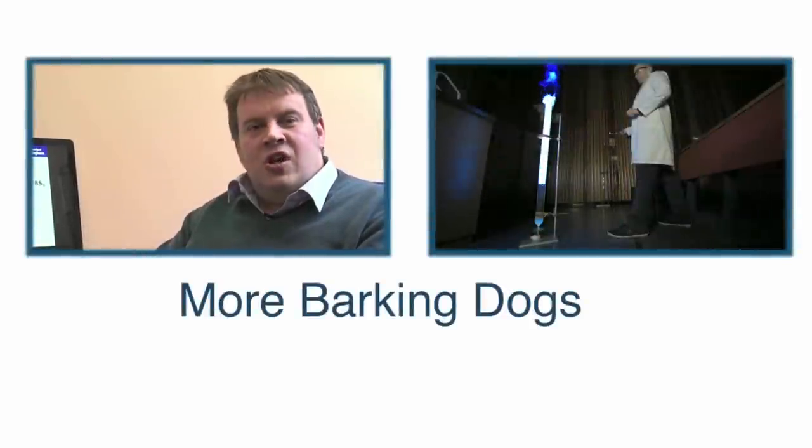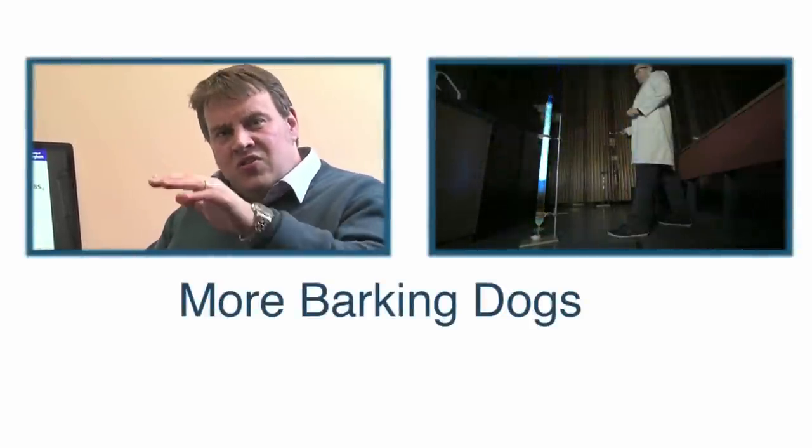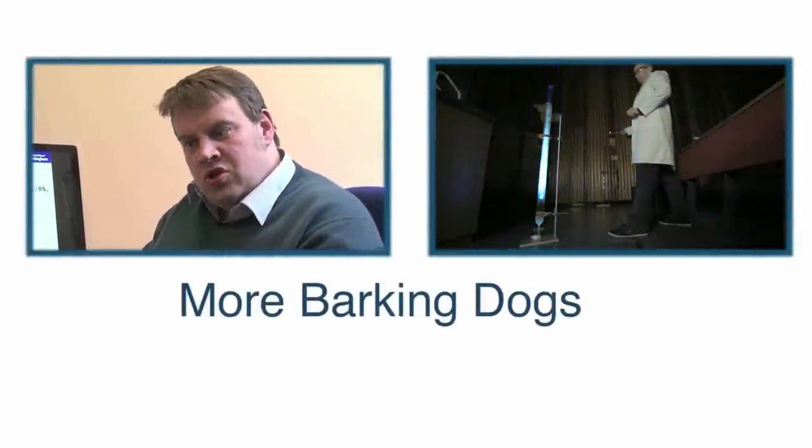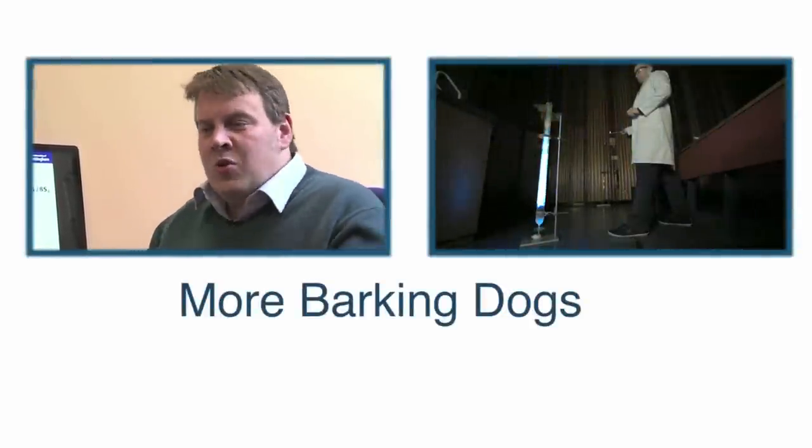But actually what this video footage has shown us is that it actually goes in stages. It sort of chugs its way to the bottom of the tube.